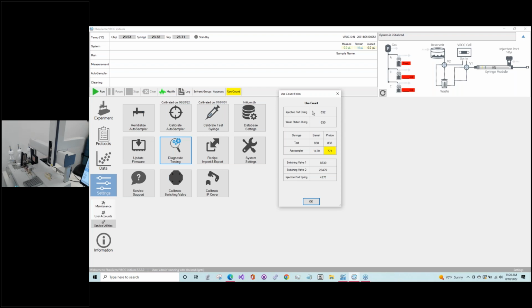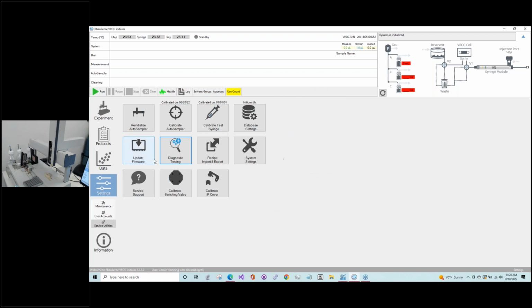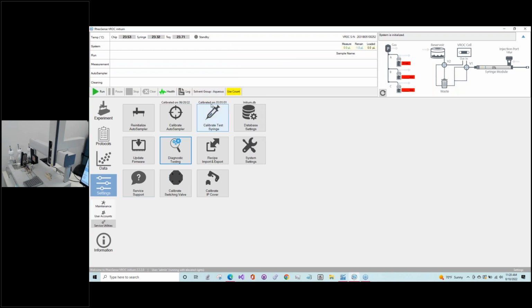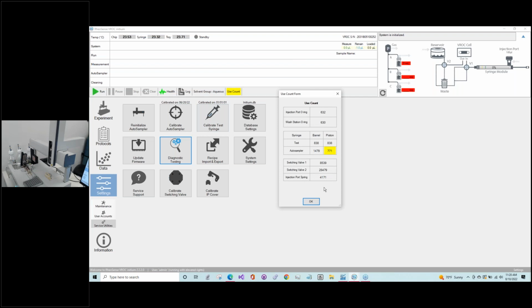So there are actually O-rings, and unfortunately I should have left open the injection port. So we'll go back to low level, open up our injection port cover, we'll leave it open and go back to use count. Okay, so we have two O-rings, those at the top on the chart there. There's an O-ring here in the injection port cover. And to swap this out, this is a part that you can purchase from us, and you'll be warned when it's aging, and once it needs to be replaced, when that block goes red. And it's just a matter of using your fingernail or maybe a spatula to pull it off and then take the new one and pop it in.